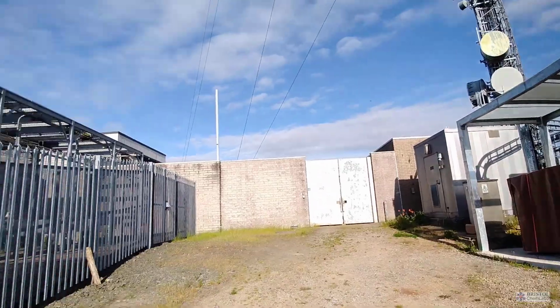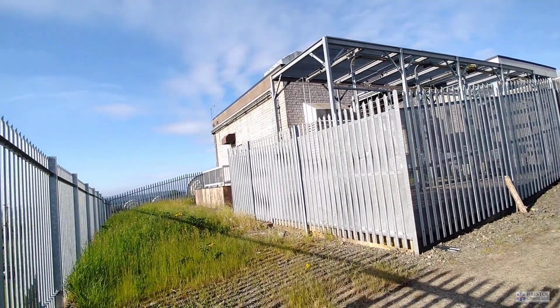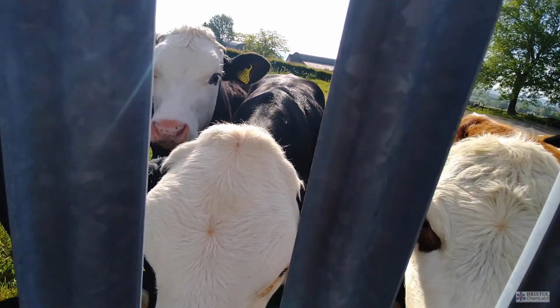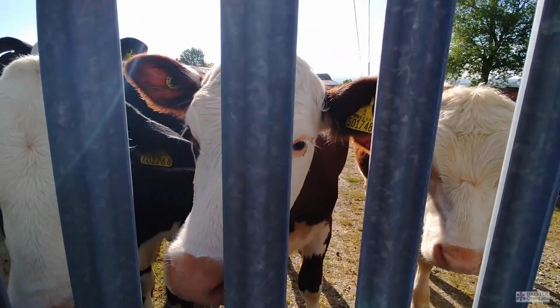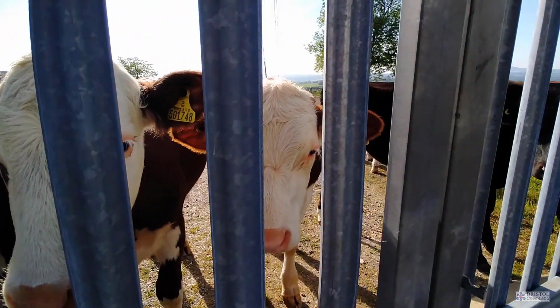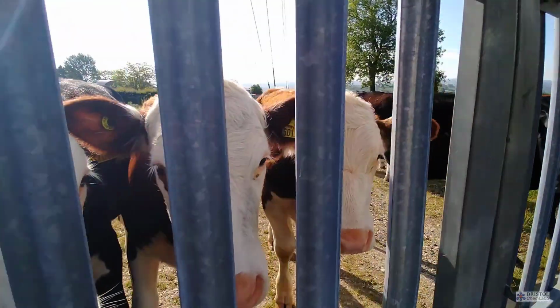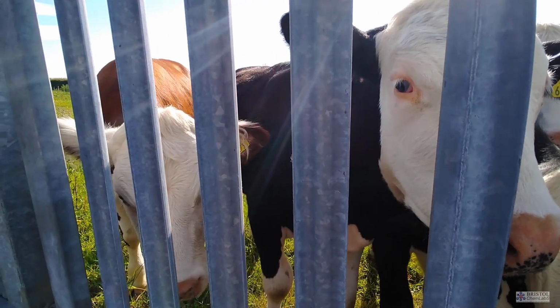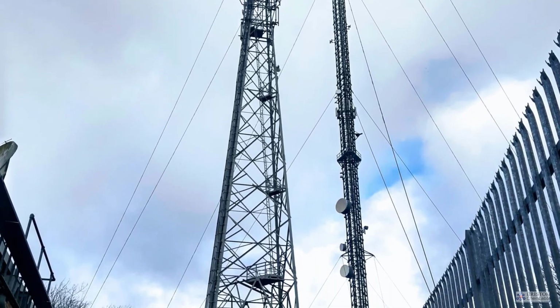And if they walk right past your instruments, then that is not very representative of the UK's CO2 emissions. That is just like, oh, I've just measured this car. So we like to measure from higher up to get better mixed air. And this is why we locate our instruments at these telecommunication towers. The highest inlet that we have is at 185 meters.